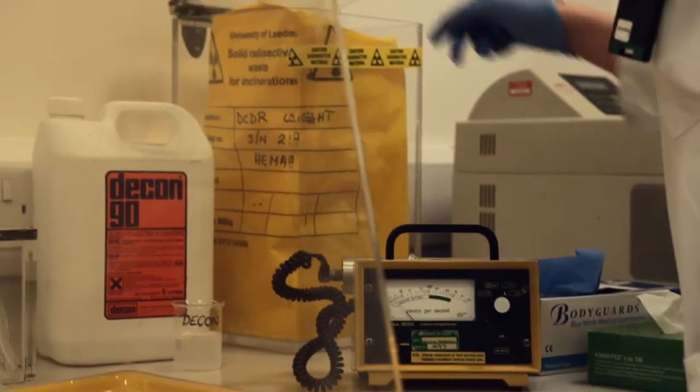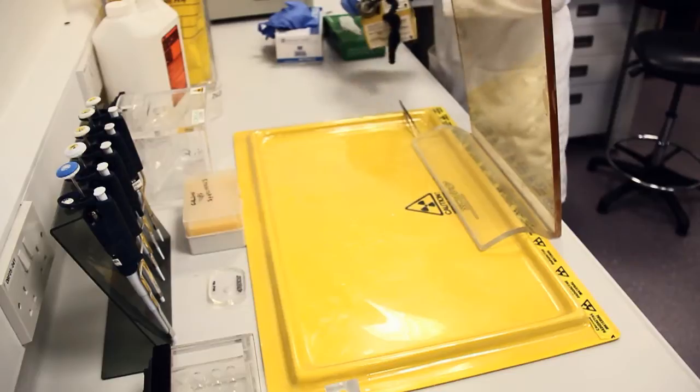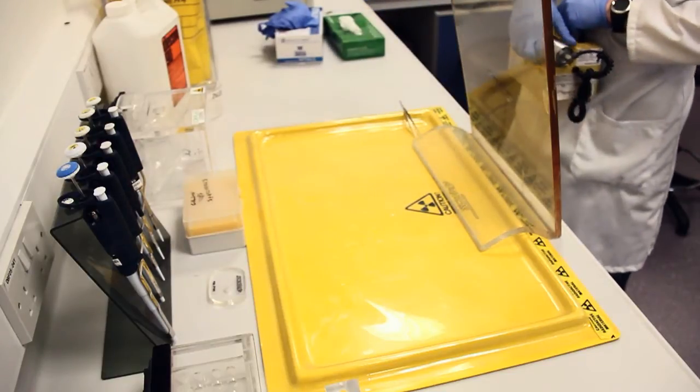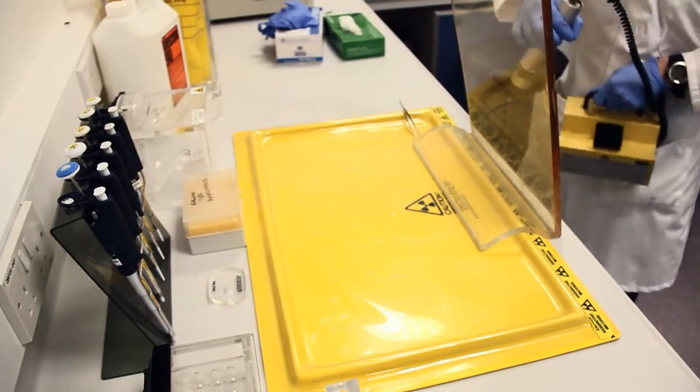David will then slowly move the monitor over the surface of the workstation to detect any contamination, giving the instrument a chance to respond.